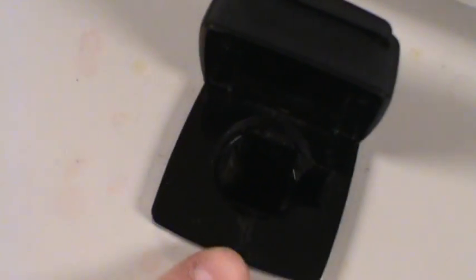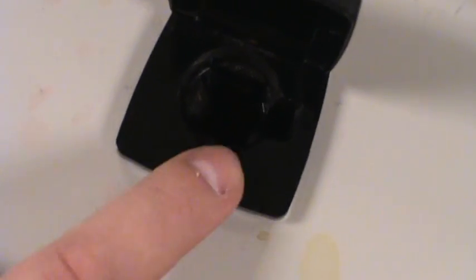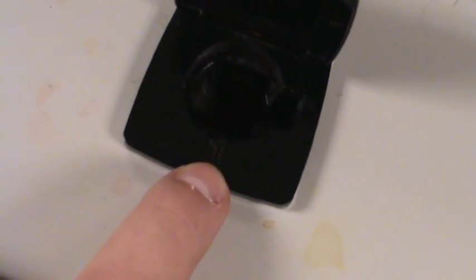The other panel, the other door over here is our sample compartment. So let's take a look at our sample compartment. It doesn't look very exciting so far but one thing that I want you to notice while we're looking is that right here there's a little calibration mark. There's a little registration mark. We're going to use that a little bit later.